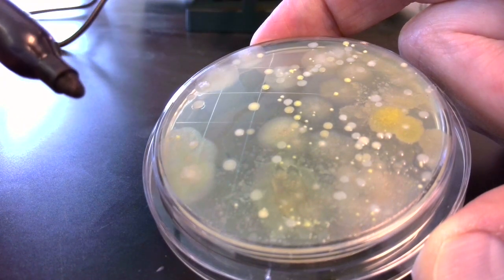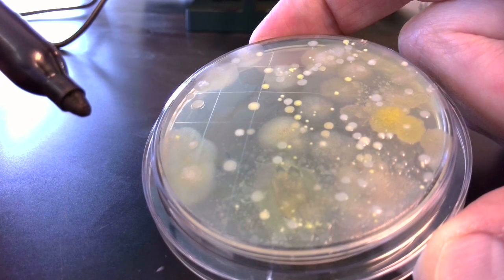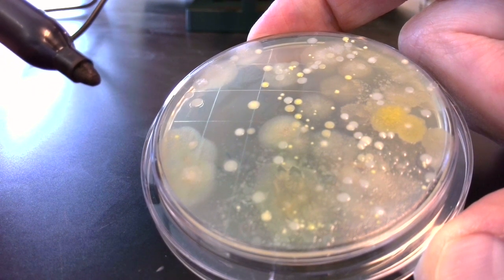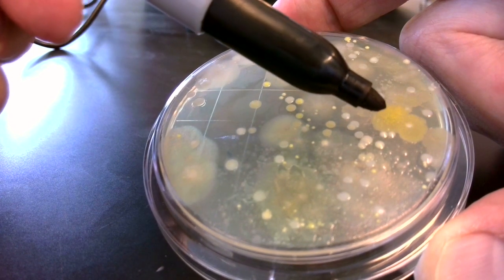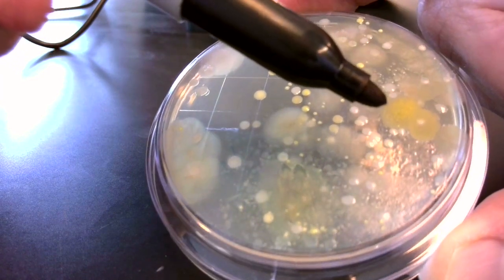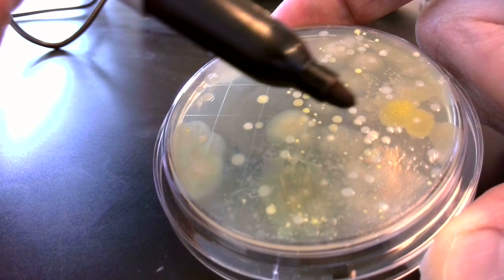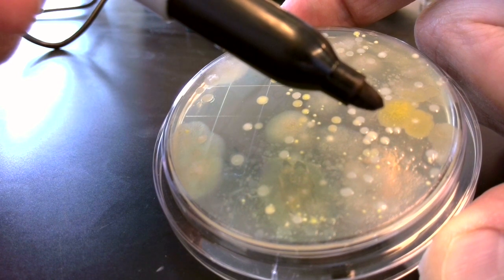These represent bacteria growing. Now, I can't say why we can know that those are bacteria. I can just say that based on experience, we know they're probably bacteria because of the way they look, their morphology. Likewise, this one right here is a different bacterium. And notice how dramatically different it looks. It has a distinctly different colony morphology. It's rippled. It's not smooth and round and circular, but yet this spreading yellow colony is certainly a bacterium.